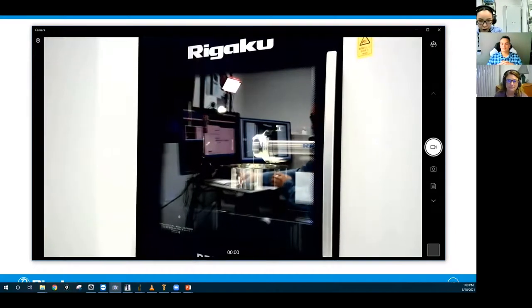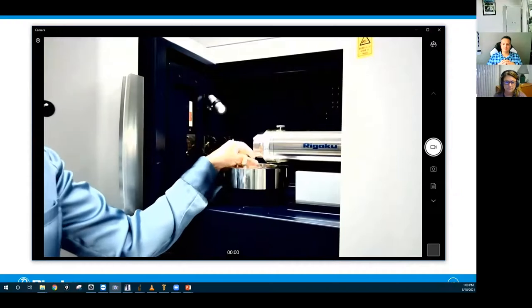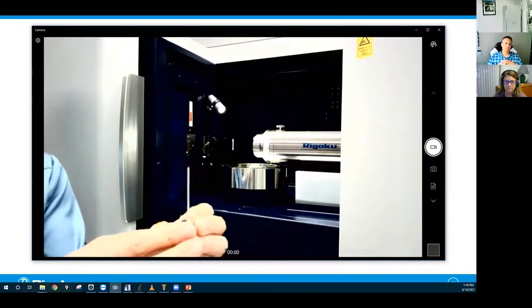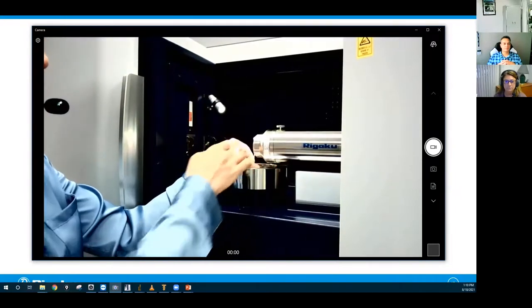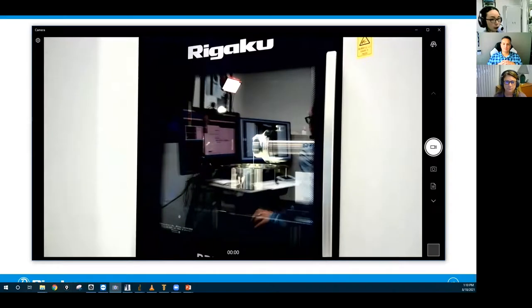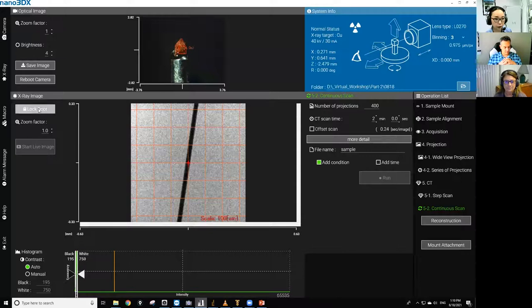All right. So let me put this on the machine. Take this one out. And you probably can't really see much, but this is a sample. And now it's on the stage. So I'm gonna switch the screen so that you can see the data collection software. Okay. So now you see the cranberry seed at the top. This is just a regular CCD camera view. And I'm gonna start the live image so that you get the X-ray view as well.